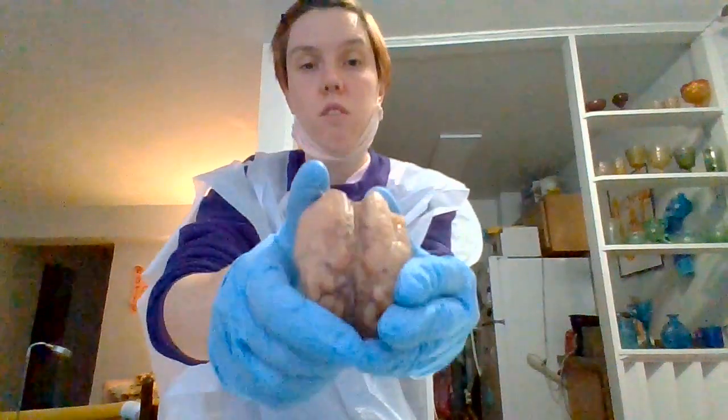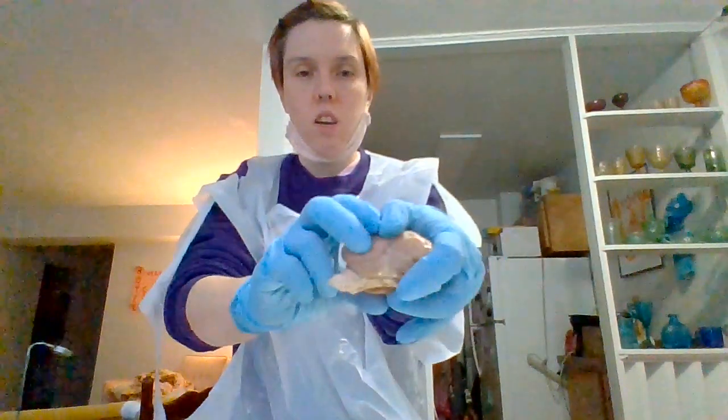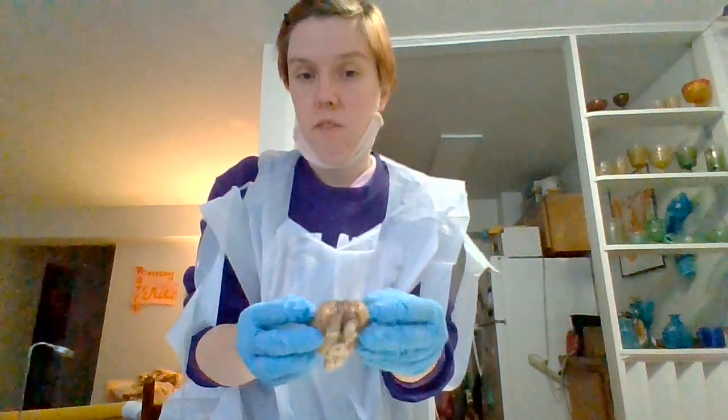Right across the middle here is the longitudinal fissure, which splits the brain into the right and the left. I actually cut the brain on the fissure, which I felt kind of bad about doing, but it's all part of the process of learning. And then on the side, you have the lateral fissure. The lateral fissure splits the frontal and the parietal lobes from the temporal lobe, the one that's right under your ears. So that's the purpose of that fissure.